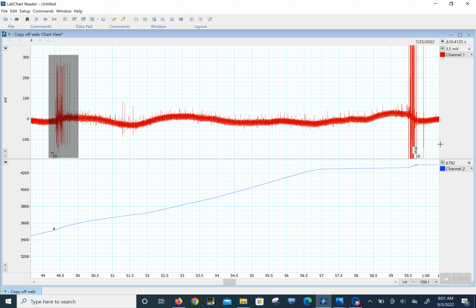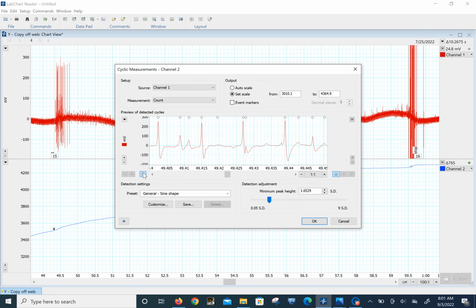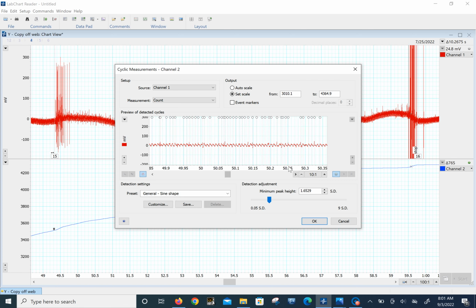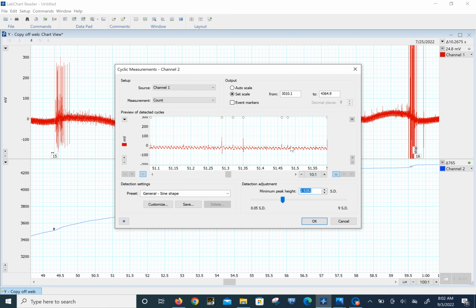So what you have to do is to go in and change the settings, and that's really a pain. And go in there and probably say, let's get down to the noise level over here. Probably raise the standard deviation to maybe something around there. So it's got the spikes this time, but not the 60 cycle noise. And there it goes. You see it's getting the spikes, but not the 60 cycle noise. So if we wanted to count those spikes this time, we could.